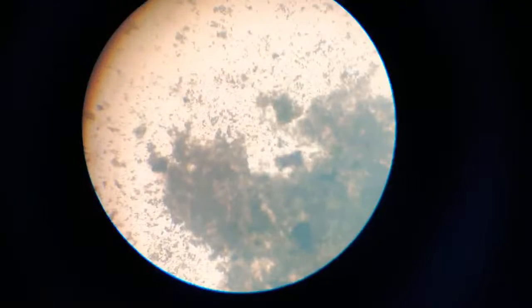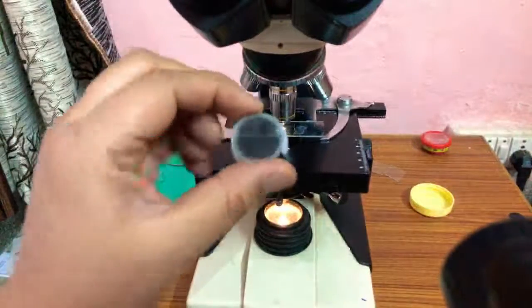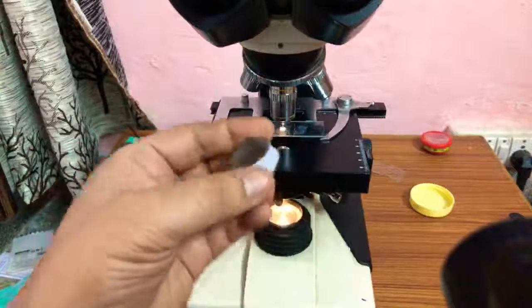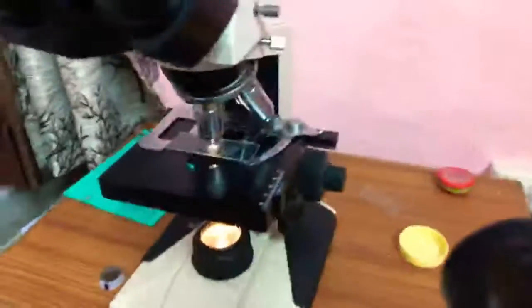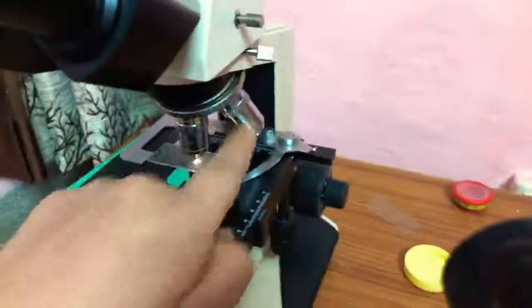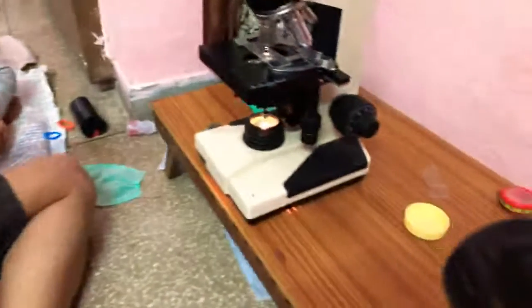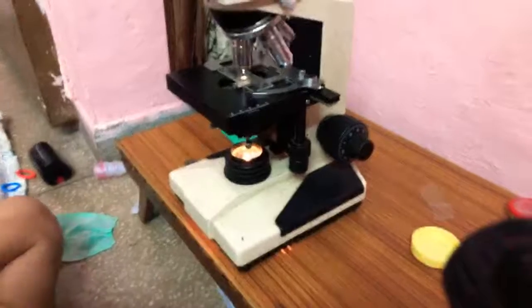My latest new arrangement, sir, I will show you. I have prepared this filter. This is a polarized layer, and a similar layer is in here. It is inside. Here is what I have tested. Another layer I will show, it is inside this.